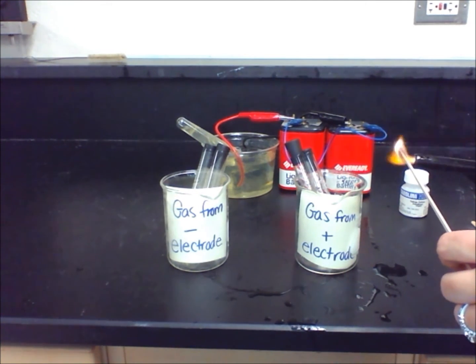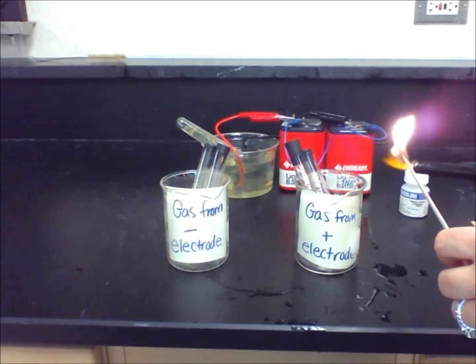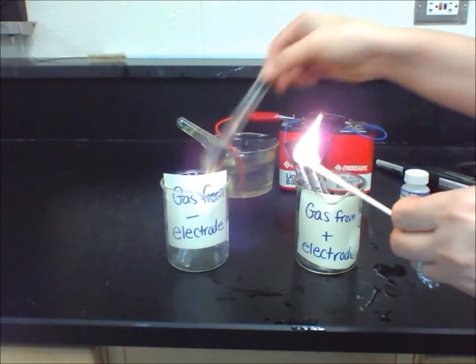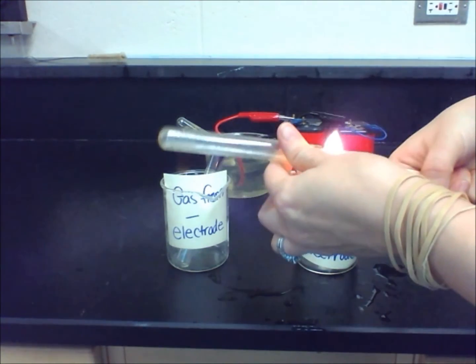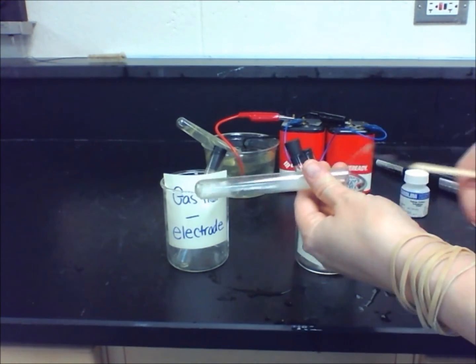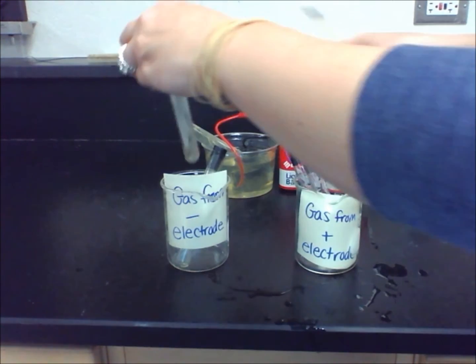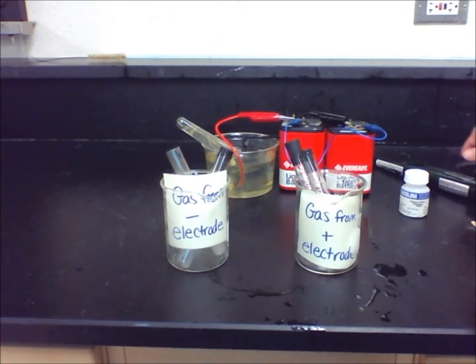In Table 1, when you test the gas collected from the negative electrode with the burning splint, you hear a squeaky pop. Please record that information for Tube 1 in Table 1.